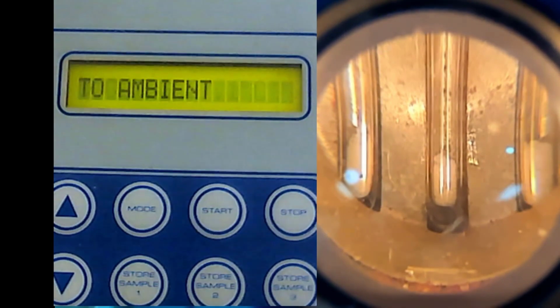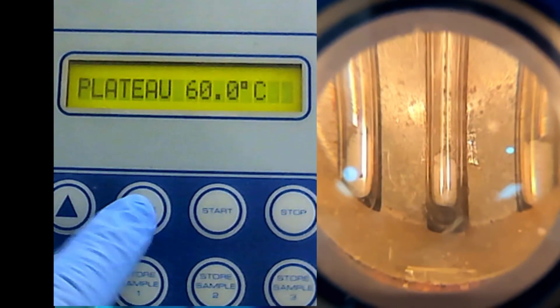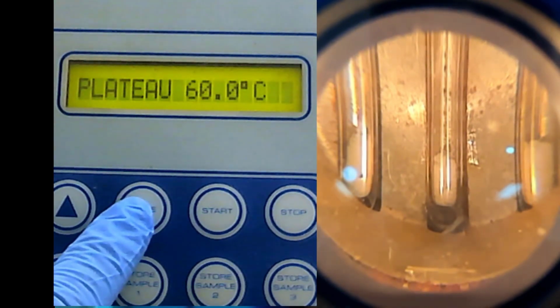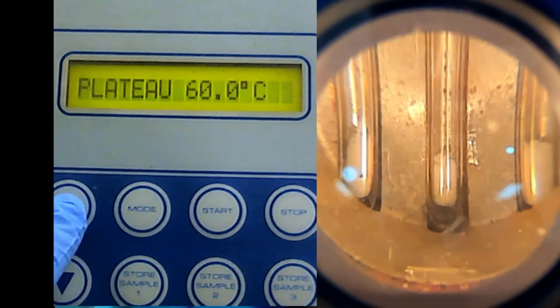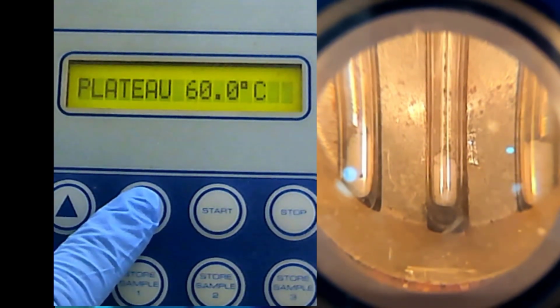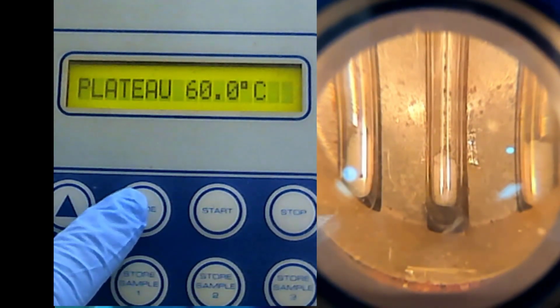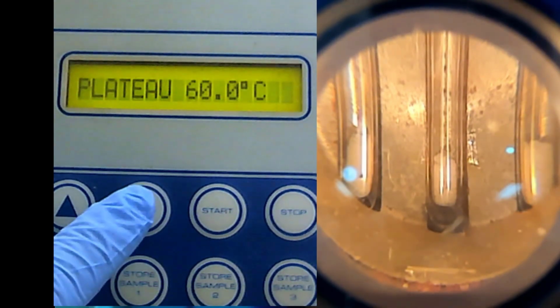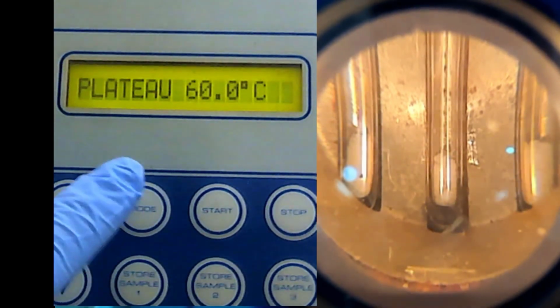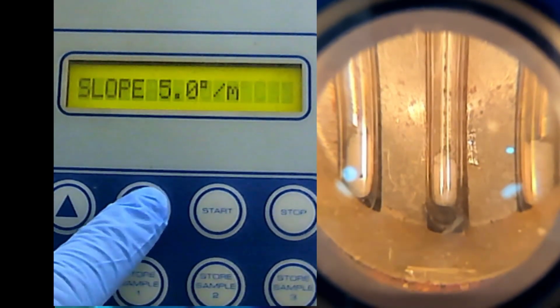Okay, so now as usual, we go to mode and the plateau. Here let's say we can put plateau 90. I think 90 is okay. But be careful, you cannot put like 100 or 100-something, because we know when you mix 2 different things, the temperature will be depressed, meaning that the temperature when it melts will be lower than the temperature at which it actually melts if they are individual. So you need to put the plateau maybe like 80.